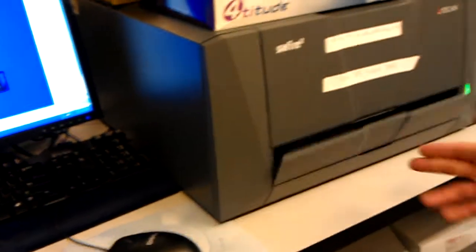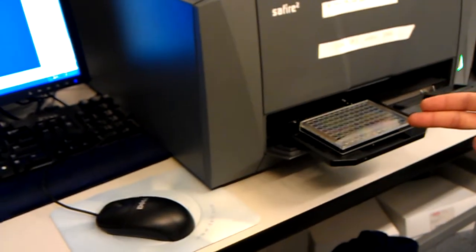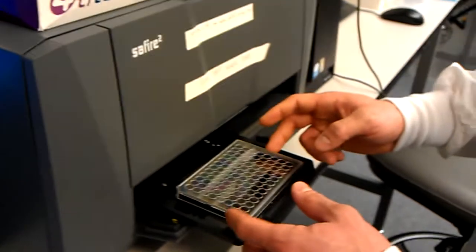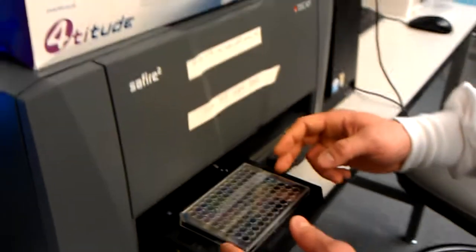And then once it connects, this is going to open, and we're going to have a plate already in there. This is a plate that we just put in there. Now, for a time reading, or a time course, I leave the top on. So that stays there. And now we're actually going to load in our time course.